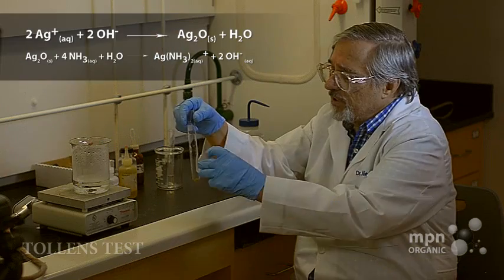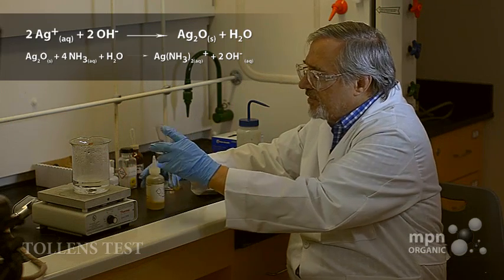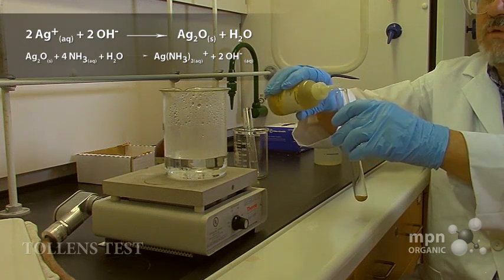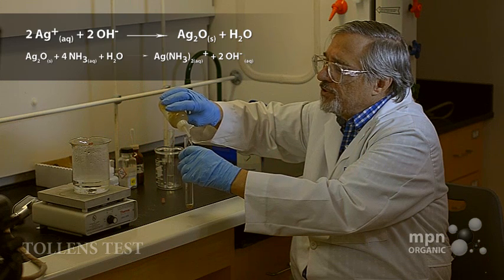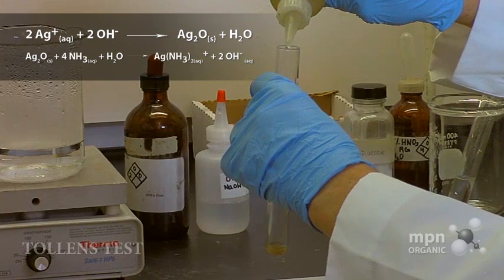We're not going to wait for that because we're going to take this now and we're going to dissolve it once again, not back to silver nitrate, but to form the silver diamine complex, AgNH3-2+, and we're going to add that like that.